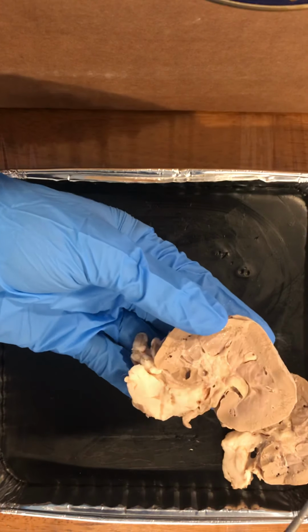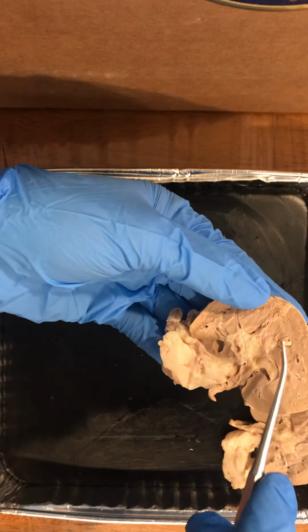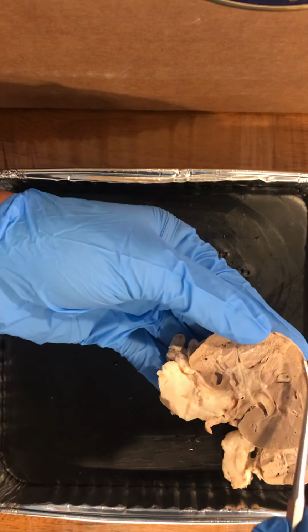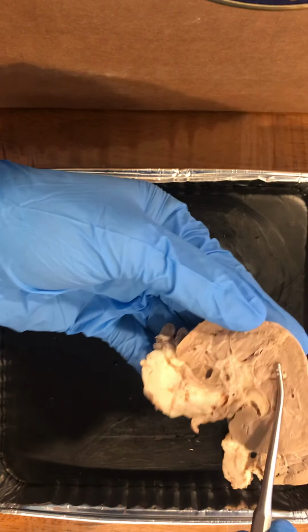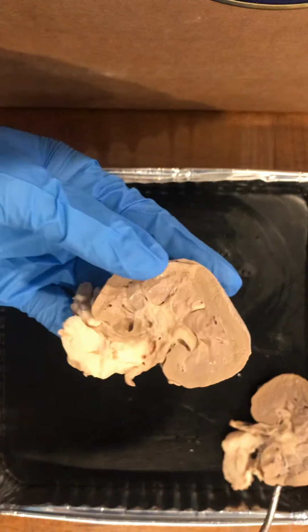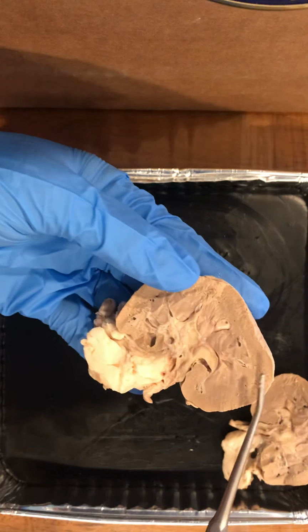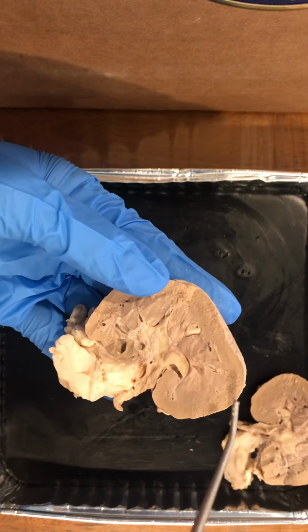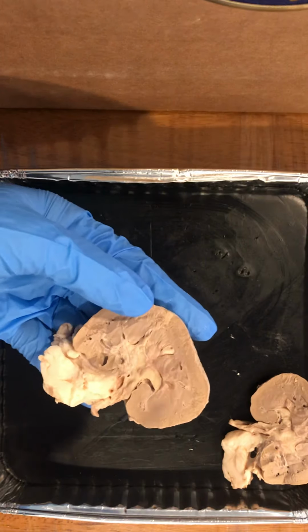The renal pyramids are separated by bands of tissue called the renal columns, which are located here. The columns begin in the cortex and extend through the medulla. The columns have a more granular texture like the cortex rather than the smooth medulla. Each renal pyramid and the adjacent cortical region make up a renal lobe, and this is where urine production occurs in the kidney.